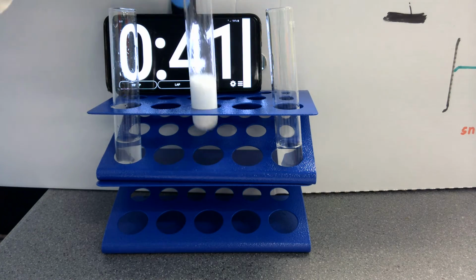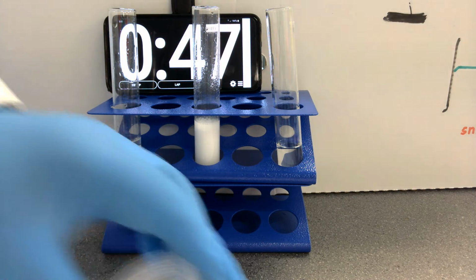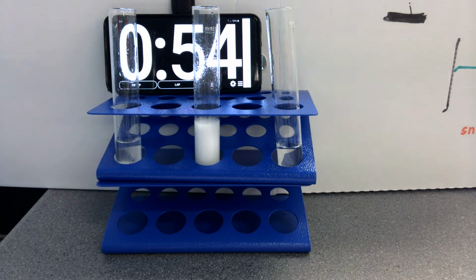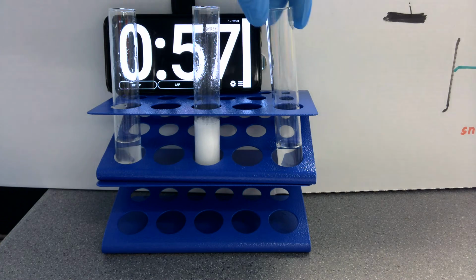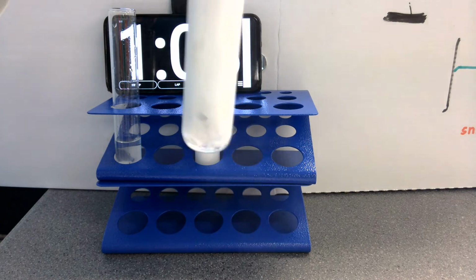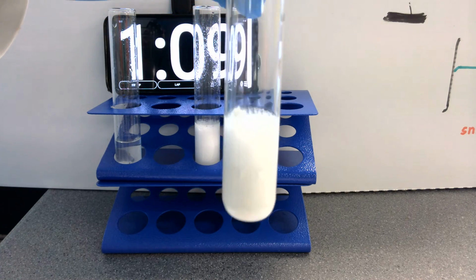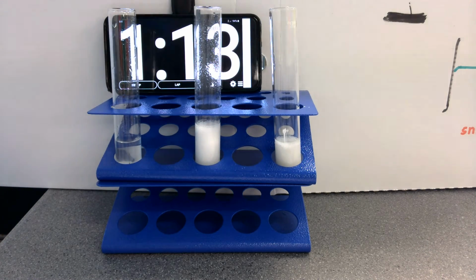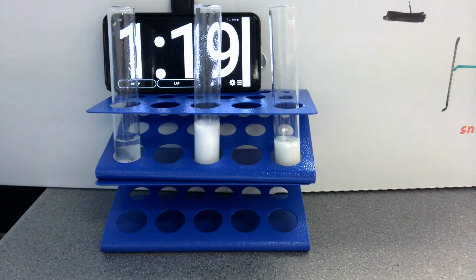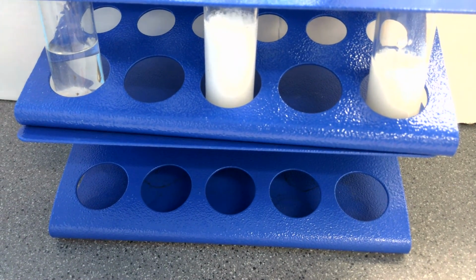So in another 20 seconds now, I'm going to add the powder with the acid, and you will see the reaction. And you can see a really violent reaction in the production of carbon dioxide gas of powder surface area compared to pieces or chips compared to chunk. And if I go in a little bit closer, you may be able to see that more clearly still. We then stop the time.